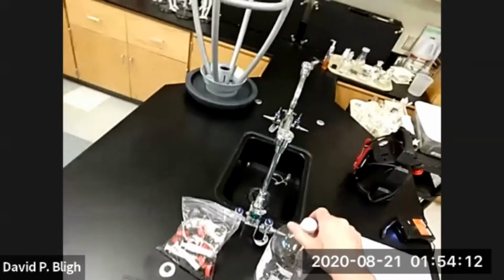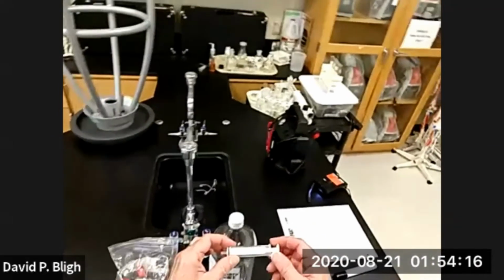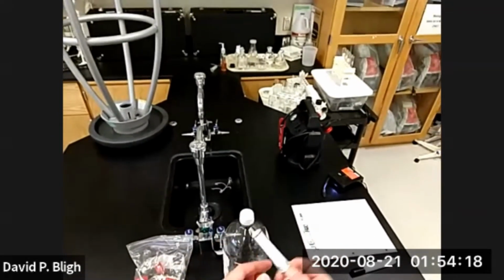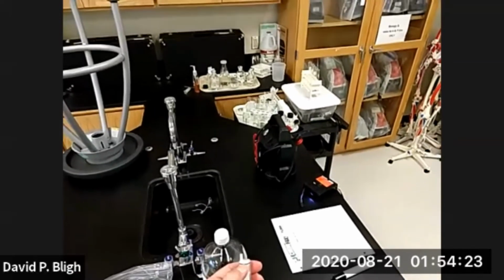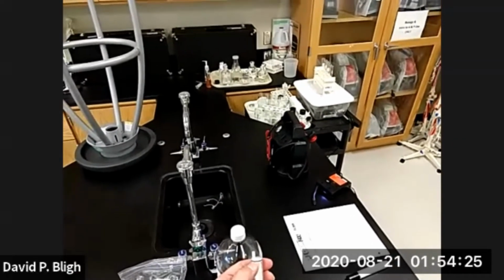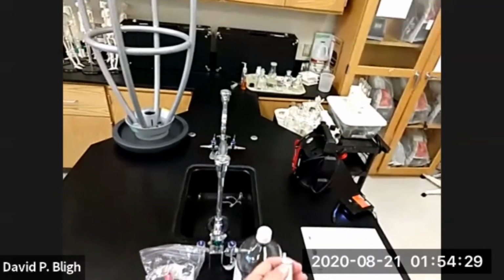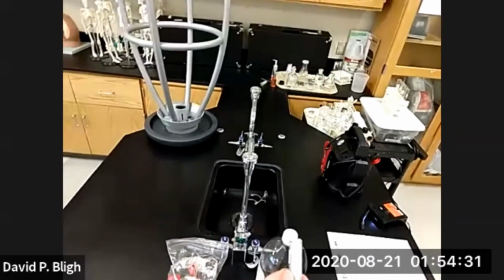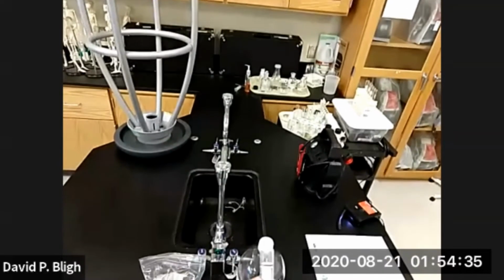So how do we trap the gas? We use a syringe. And these are not your typical syringes, because the seal at the end of the plunger doesn't provide so much friction as you would normally see in one of these plastic syringes. So it behaves better, it behaves more ideally.